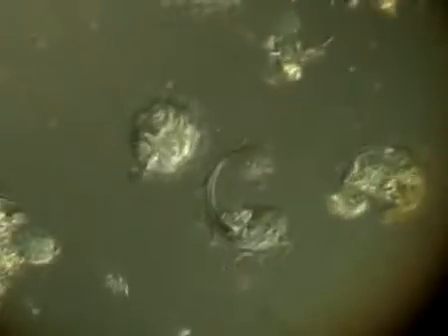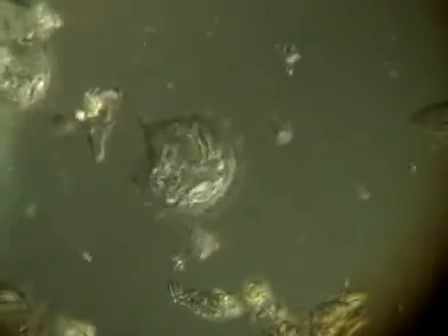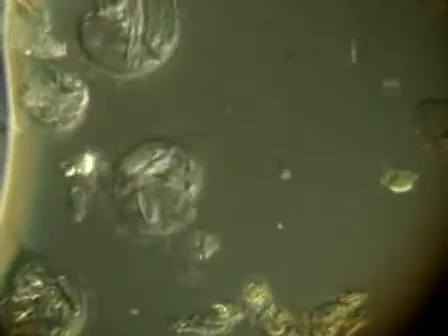We also have the capacity to do something called DIC microscopy, so differential interference contrast, which, as opposed to giving you contrast in terms of either white and black or sort of dark and gray, gives you more of a lunar landscape type of edge contrast, in the sense of when you look at the moon with binoculars and it's all gray, but when you focus it, you'll start to see edges very nicely. So I've set this right now to look at the sample using this DIC. What that does is give you surface textures of cells and internal structures of cells, if they're large and if they have those structures, much more cleanly.